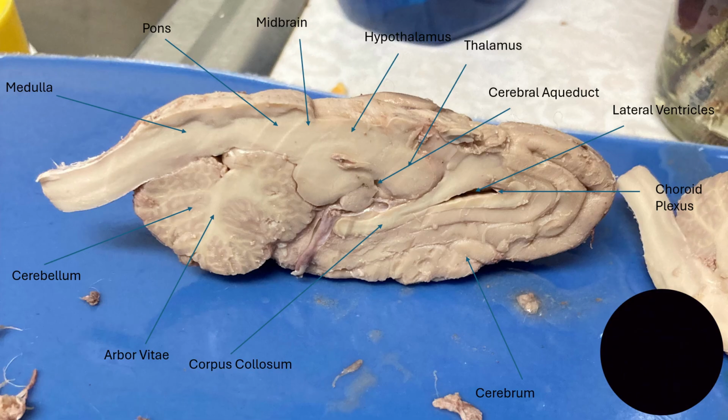This thicker white band here is also going to be our corpus callosum, which is the thick band of nervous tissue that connects the hemispheres of the cerebrum. And then also the choroid plexus, which you can kind of see is the dark area surrounding our ventricle right here as well. Those are the capillaries in the roof of ventricles, and they also make cerebrospinal fluid. The ventricle is going to be this hole that we have right here. That's the lateral ventricle. All ventricles are filled with cerebrospinal fluid.